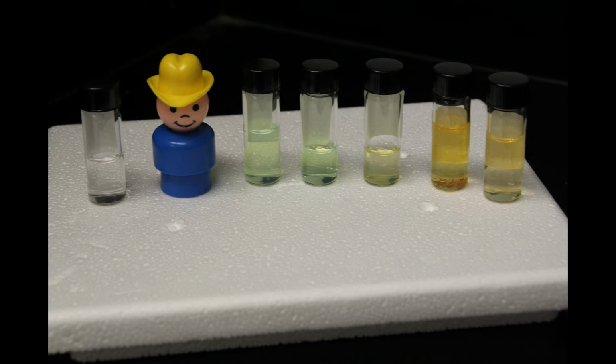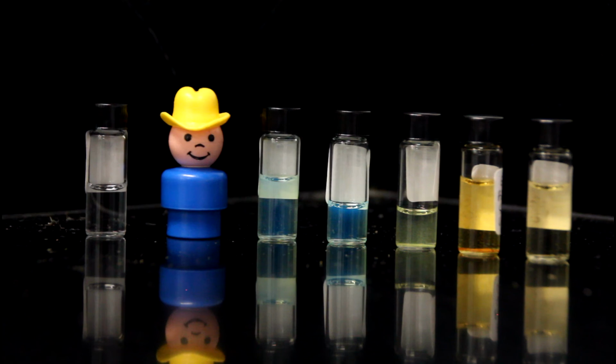For today's experiment, we prepared a dye called naphthalene 2,3-dicarboxaldehyde. It's in the vial on my right, and it doesn't fluoresce very well by itself. But when it reacts with an amine group, it loves to fluoresce. We mix the dye with several different molecules that are on my left. Can you guess which vials have amines in them when we turn on the ultraviolet lamp?